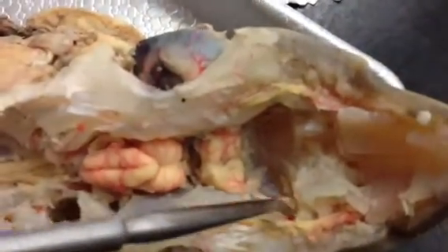On the actual specimen, here is the olfactory tract. Next to it is the terminal nerve zero — on the exam, you want to make sure you put the number of the nerve as well. It goes into the olfactory bulb and then the sac, which is the rounded part. You can't see it because I didn't open that part, but it's the little bulb — the actual sac.